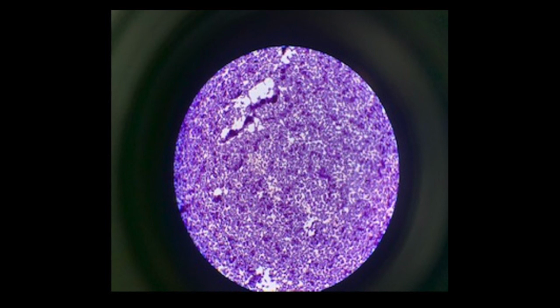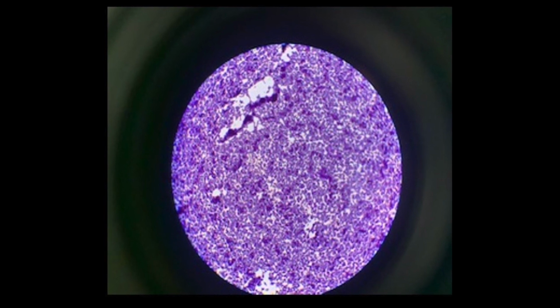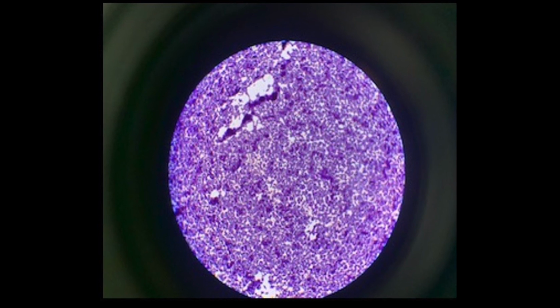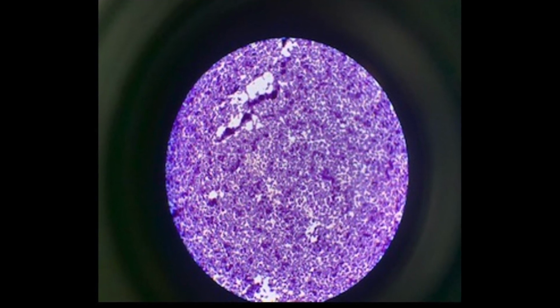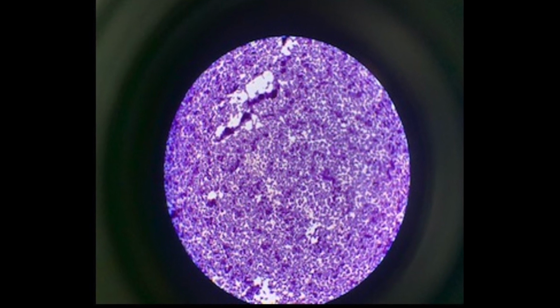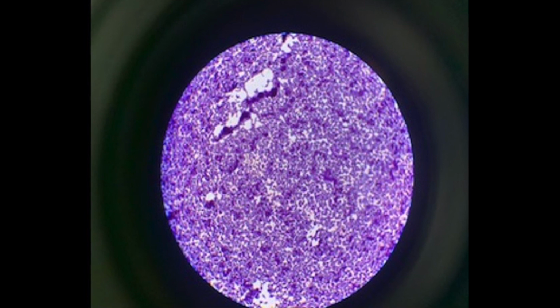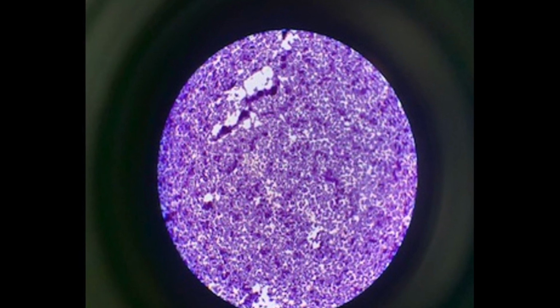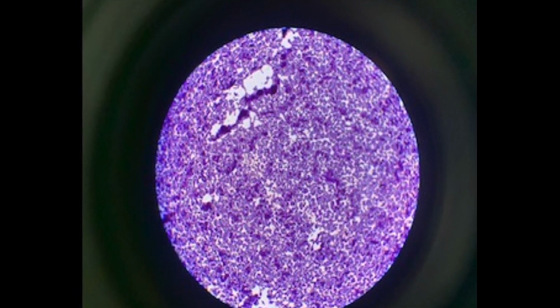Okay, so here is our gram-positive smear. So if you remember, we had two smears on one slide. We had our gram-positive cell, which was staph, and we had our gram-negative cells, which are E. coli. So this is what a gram-positive cell should look like under the microscope. Notice that nice, dark, deep purple color. And this is staph, staphylococcus, so it's forming those large clusters, and that's what you're seeing there. So we want that nice, dark, deep purple, and that's what we're getting.